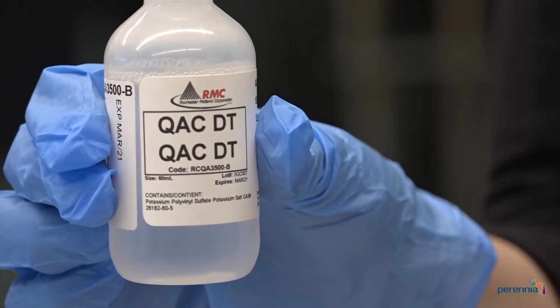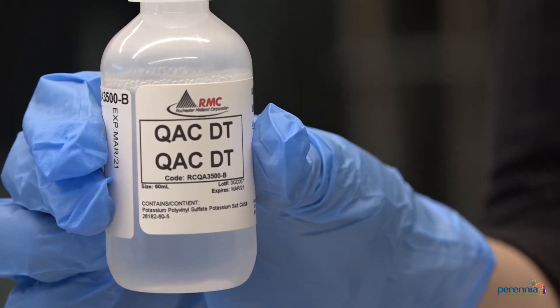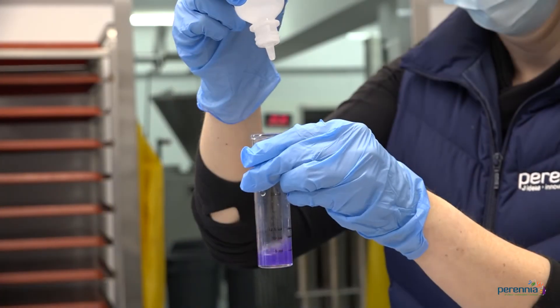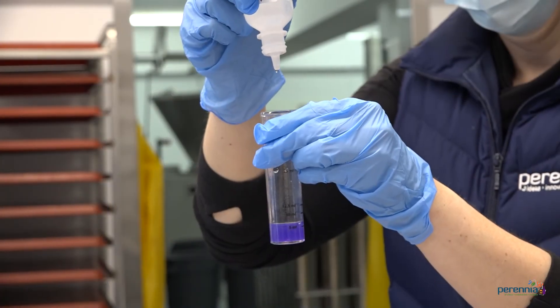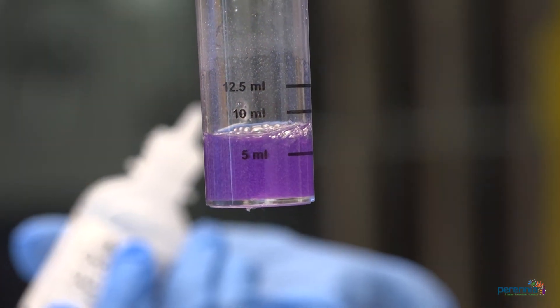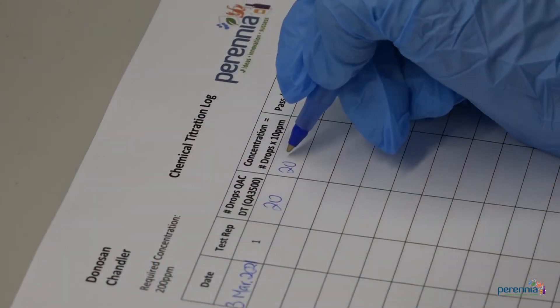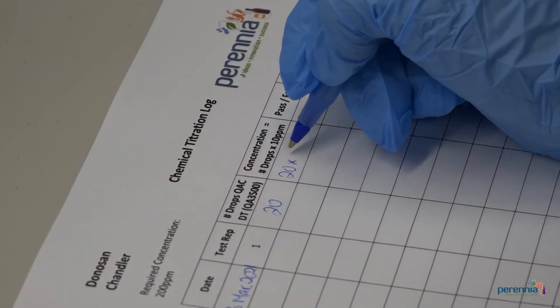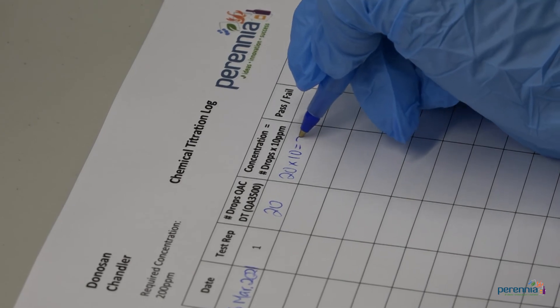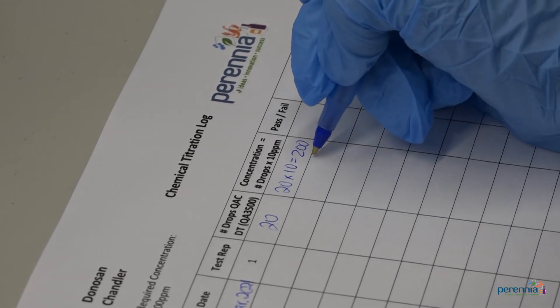Step 7: add QACDT QA3500 one drop at a time while swirling. Count the number of drops until the sample color changes from blue to purple pink. Step 8: record the number of drops times 10 parts per million. This gives you the concentration in parts per million. Record this on your monitoring record.